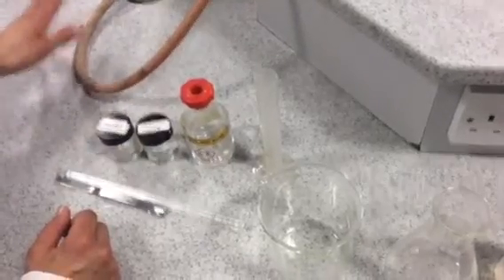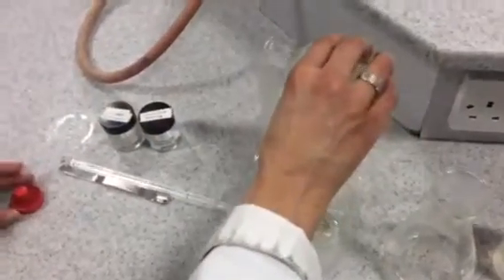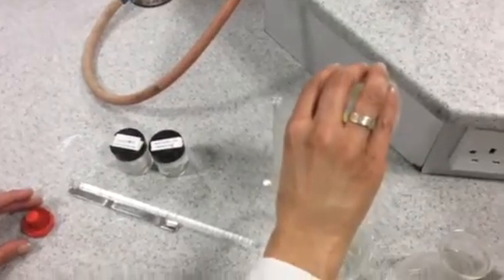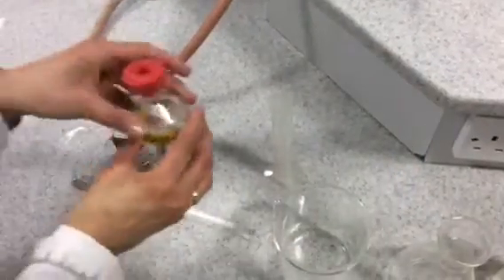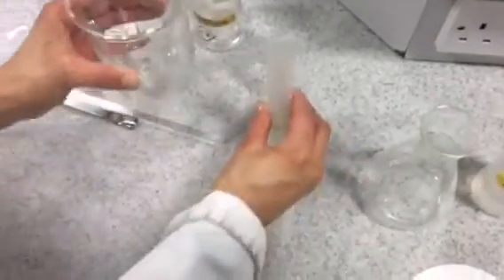You're going to need a Bunsen burner set up on a safety flame. We're going to start off by measuring 20 ml of sulfuric acid using a measuring cylinder. The sulfuric acid is going to be neutralized by the base in order to make a salt.